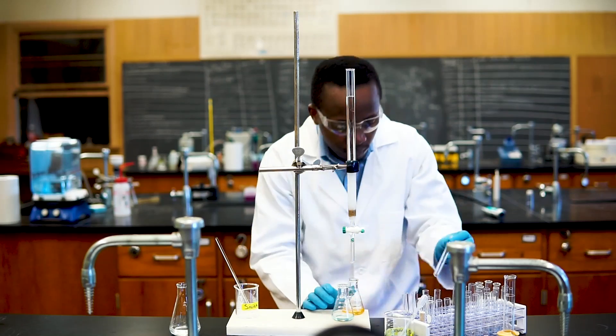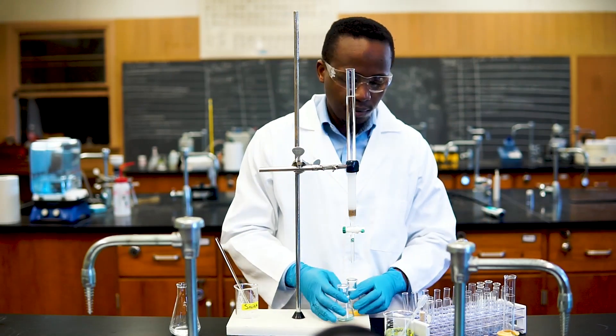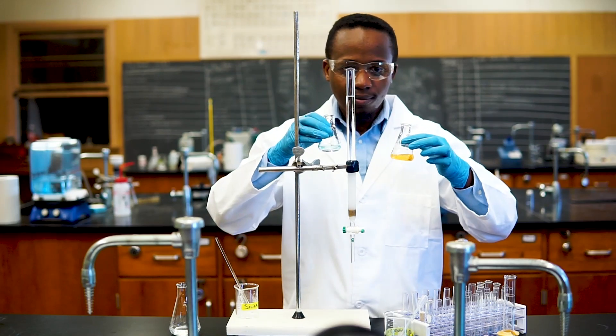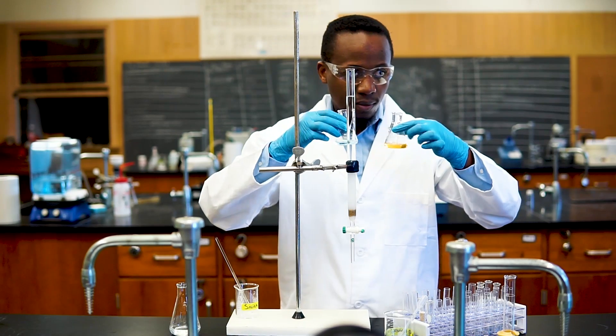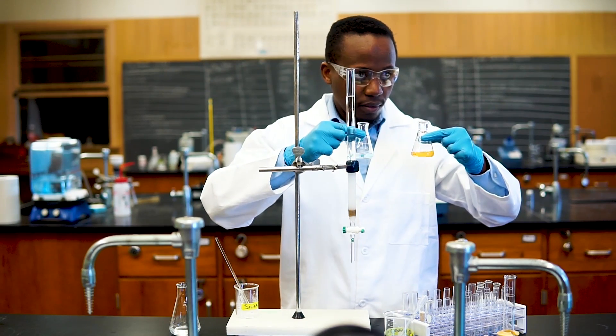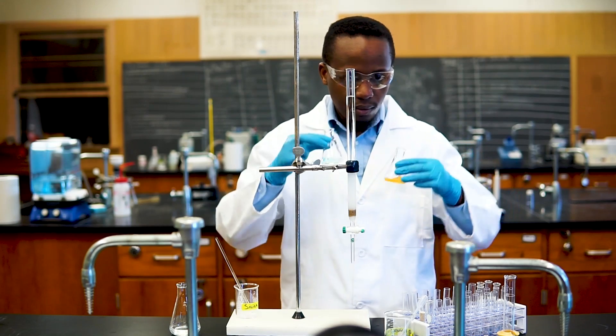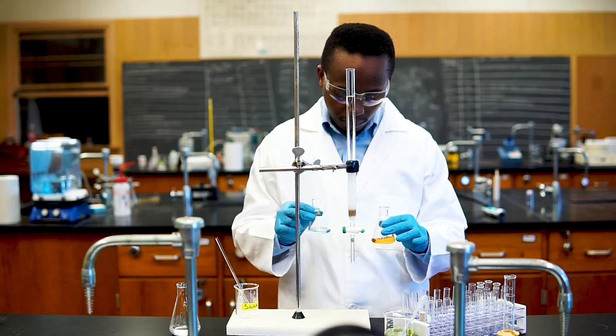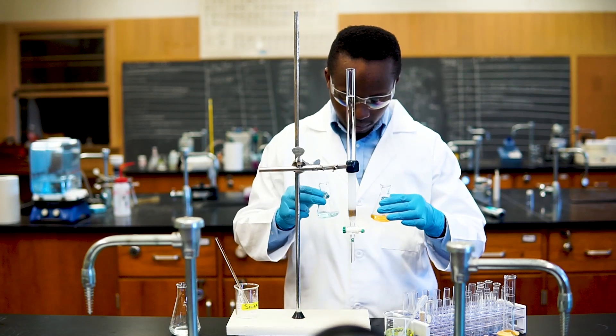There are times where, rather than TLC, you will want to analyze the fractions by absorbance spectroscopy, UV, or a colorimetric assay to figure out the identities of any compounds. But in this particular case we were able to isolate these compounds using just our eyes.